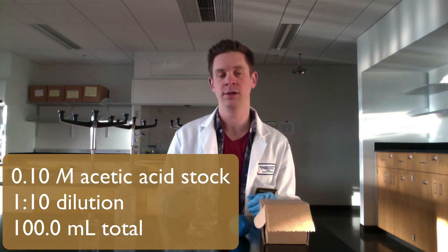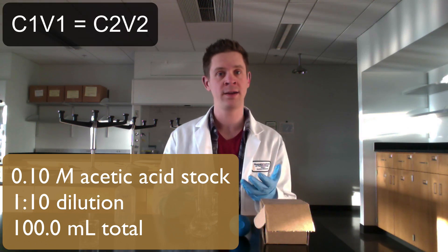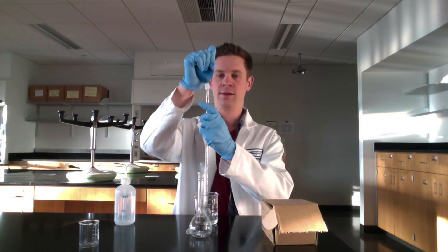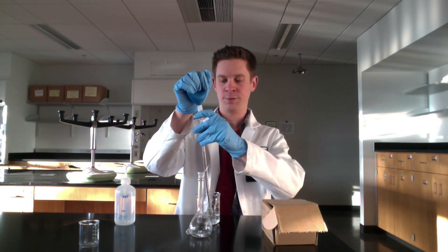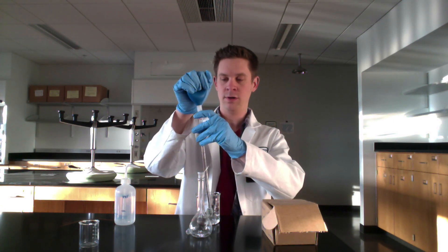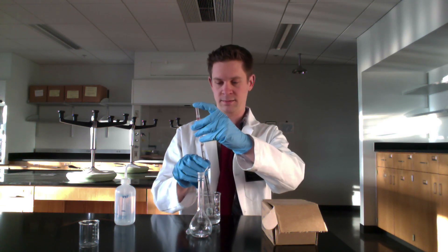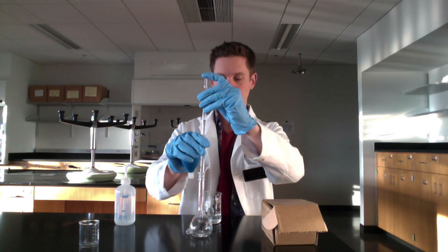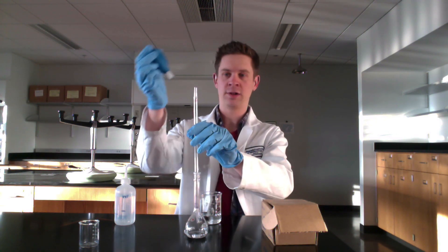We're making a 1-to-10 dilution with a total volume of 100 milliliters. A 1-to-10 dilution means for every 1 milliliter of stock there are 10 milliliters of final diluted solution, so we need 100 divided by 10, or 10 milliliters of the stock solution. I'm pipetting 10 milliliters of the stock acetic acid solution from the beaker. You want to be as precise as possible; if your volume is a round number like 10 or 5 milliliters, a volumetric pipette may be better than a serological pipette. I'll transfer it directly to the volumetric flask, placing the pipette toward the bottom to minimize splashing, then blow it out.